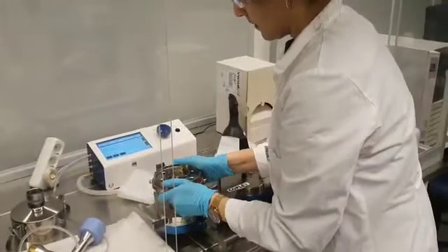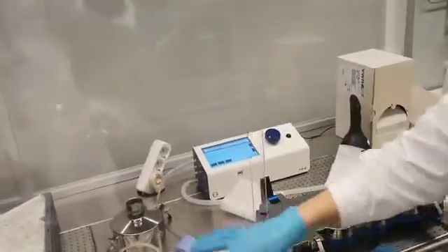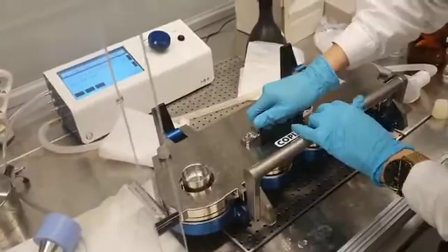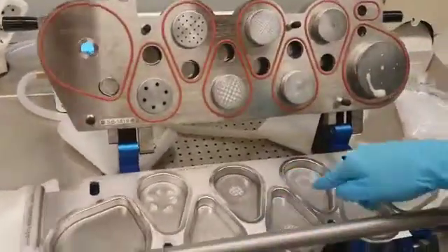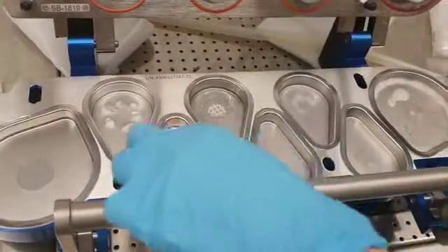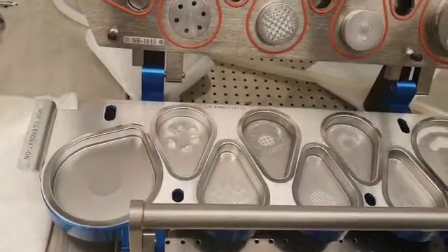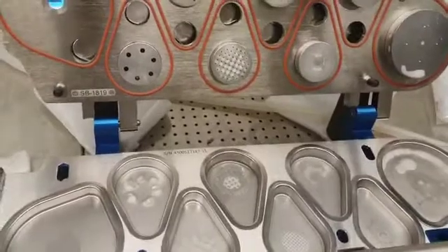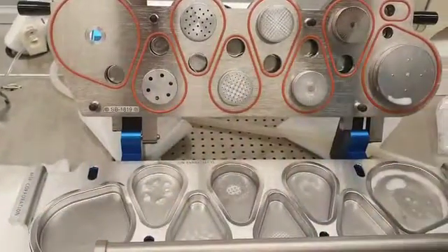So now you're opening up the system and we're going to see where the particles landed. These are quite big particles that are stuck probably in the throat — it's kind of like a pre-separator for the system. So this should show different parts of the lung. The particles have landed here — as you can see, there's a pattern inside. It goes from bigger size to smaller size: stage one is the larger particles, and over here in the deep lung — to the right — versus the throat side to the left. So from throat to the deeper side of the lung.